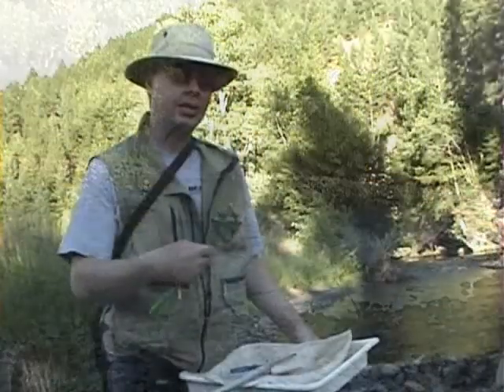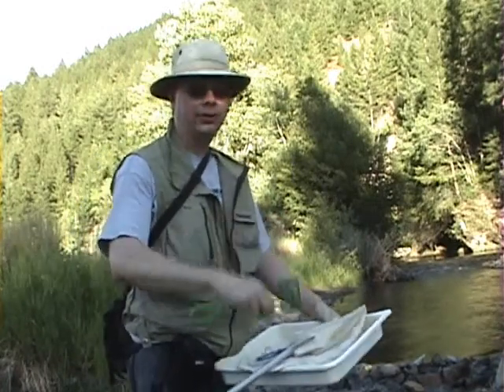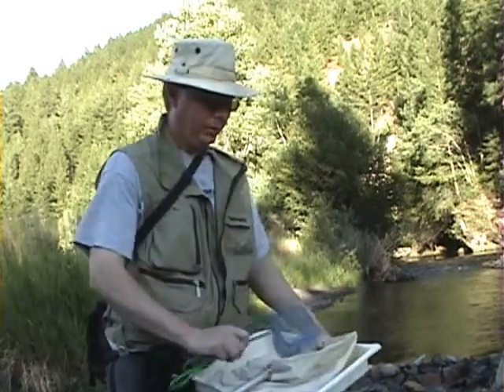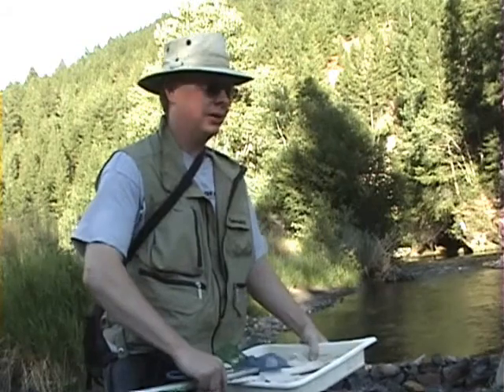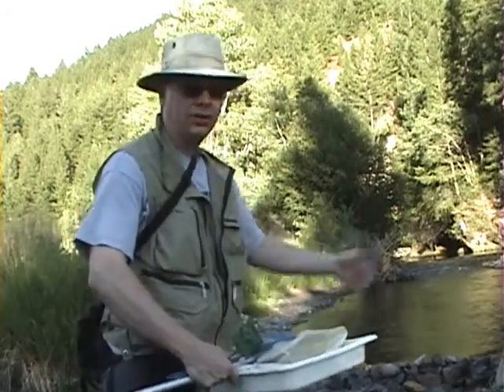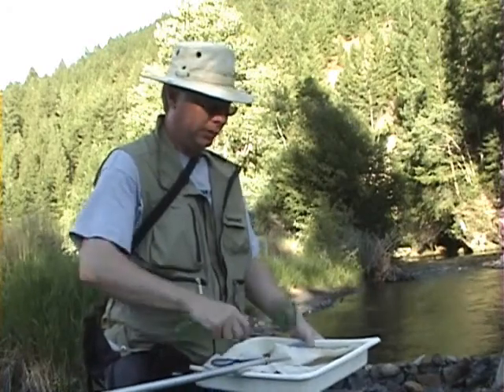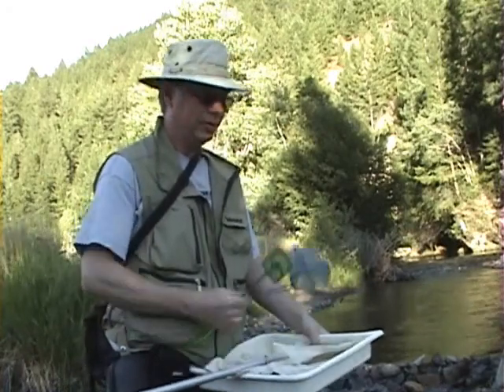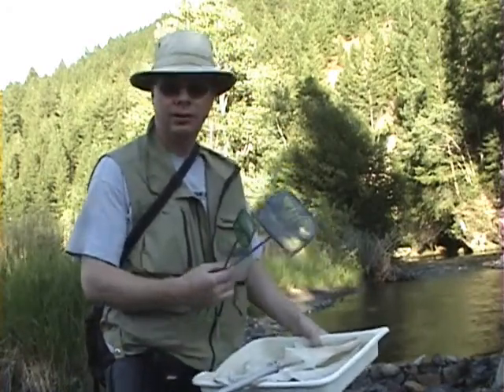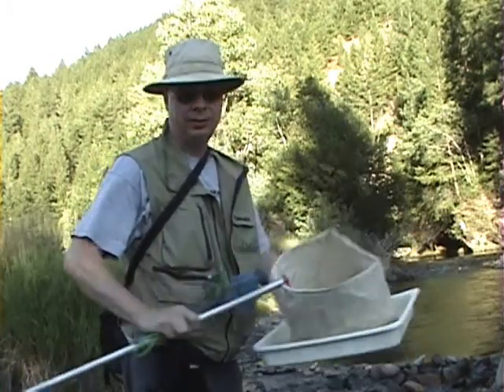Here we are at this upper stretch of Trail Creek, the upper 20 to 30 meter stretch we're going to work on today. And again, we're going to look at the diversity of the hosts in this much different system than we were in Boise. If you recall, I used a smaller aquatic net available from the pet store in Boise. But I'm going to use a larger D net.